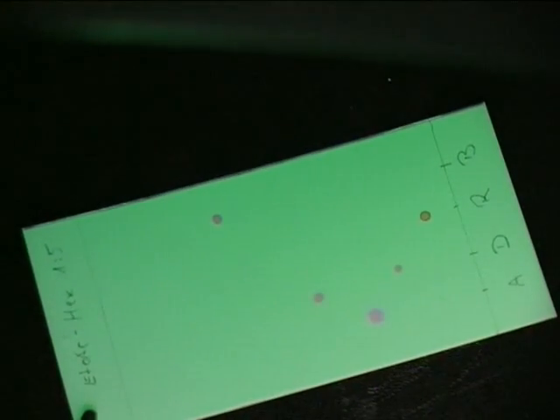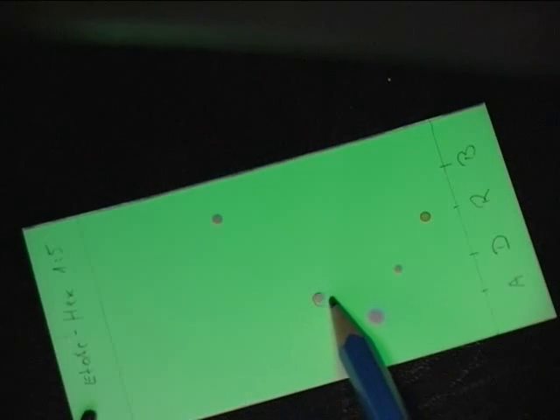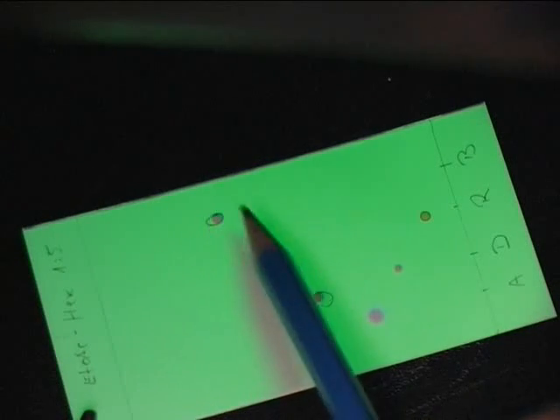After you've taken your TLC plate out of your TLC jar, you want to visualize your spots. Sometimes you can see it already under normal light, but quite often you will see some spots under UV light, that is shown here.